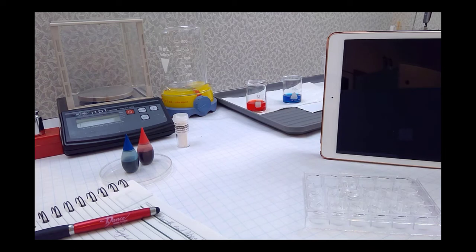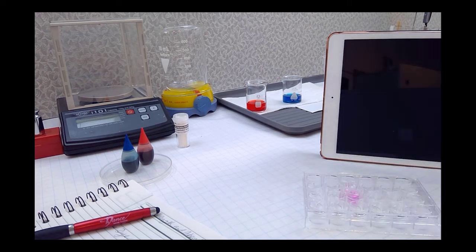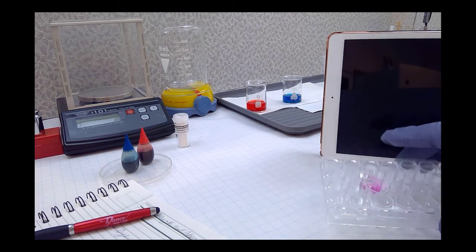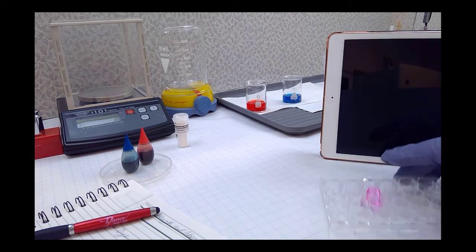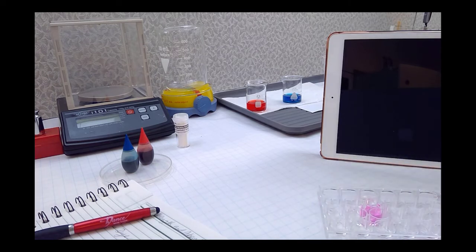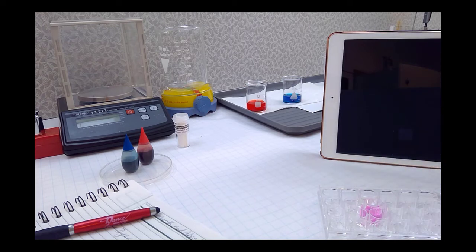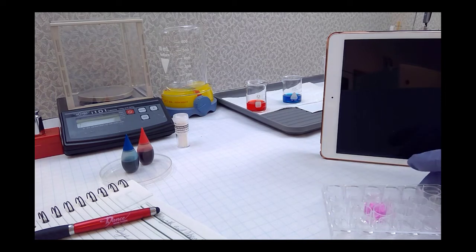I have 40 drops of water and my phenolphthalein in there, actually 39 drops, and I'm going to add just a drop of sodium hydroxide to this, and there's our beautiful magenta again that you can see. In fact, I think I'll add a second drop to see if I can get a slightly darker solution of that phenolphthalein. This is 1/10 molar sodium hydroxide, and that'll react with all the phenolphthalein that's there.